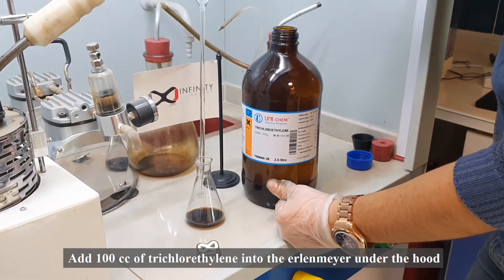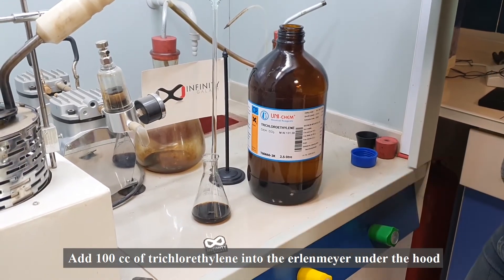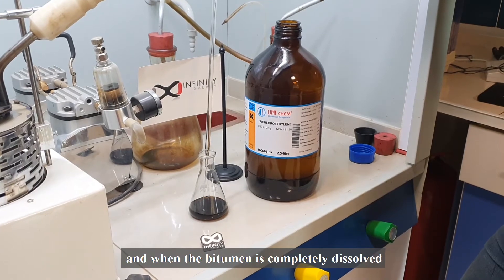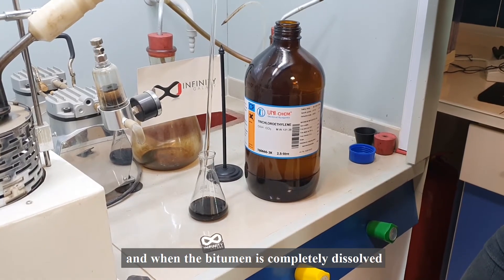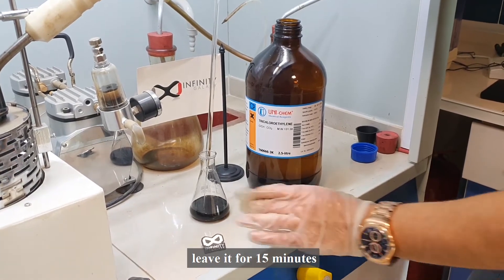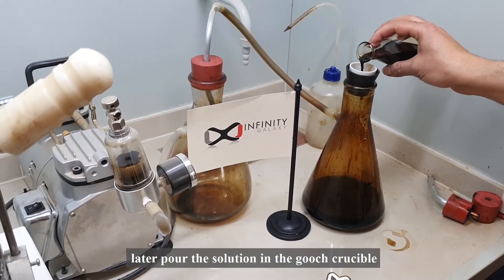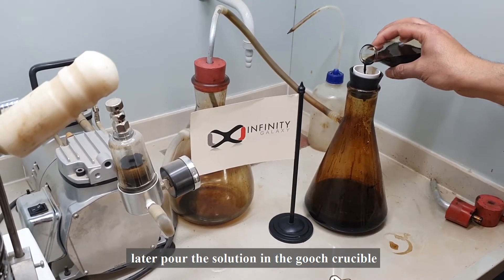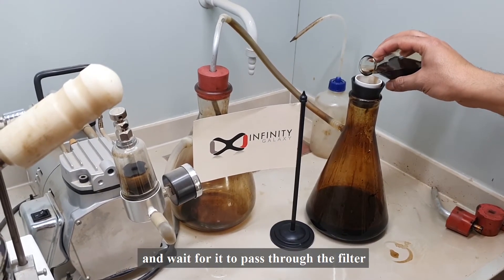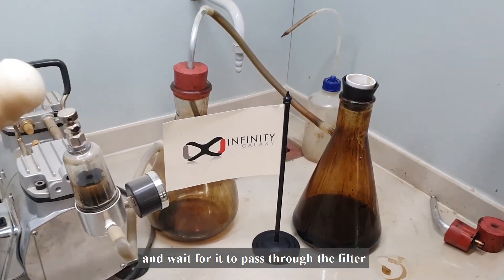Add 100 cc of trichloroethylene into the Erlenmeyer flask under the hood. When the bitumen is completely dissolved, leave it for 15 minutes. Later, pour the solution into the Gooch crucible and wait for it to pass through the filter.